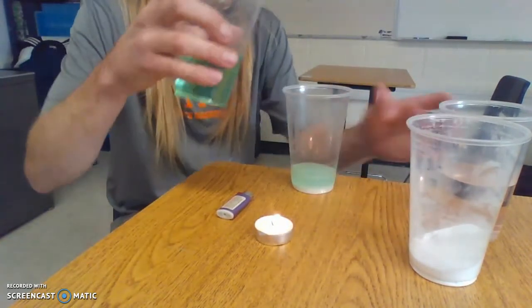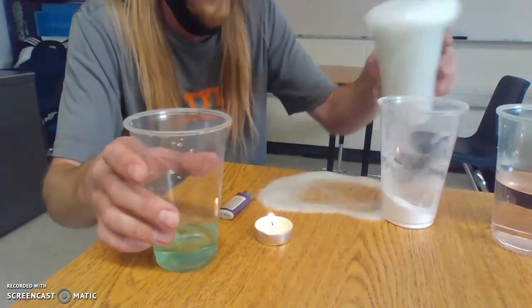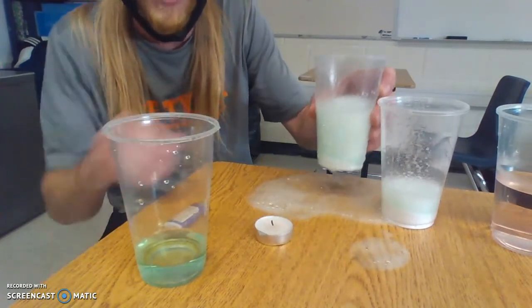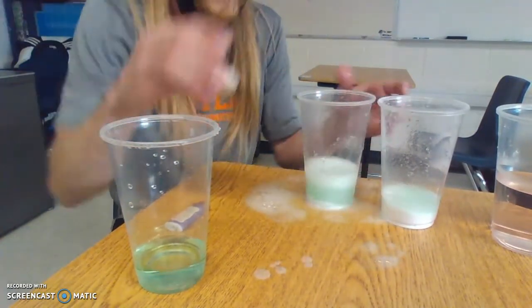So let's do it again. If I mix, let's see if I can do it without rinsing out my cup. Add some more reactants in here. Whoa! That got crazy. But look, I'll try not to spill. Now use the gas. Boom. Right? Again, I'll tip it over. There's some wax in there, but there's no water or liquid that's going to fall out.